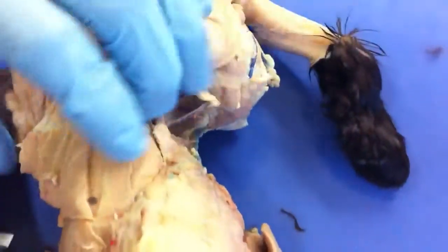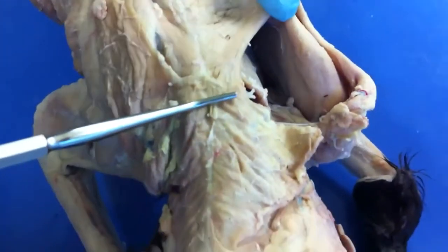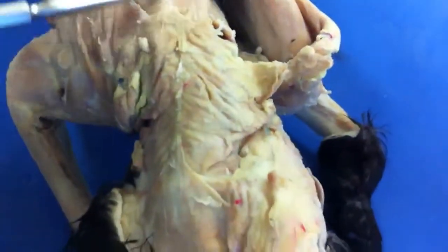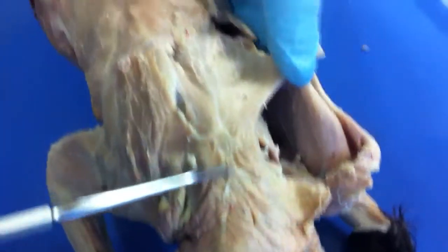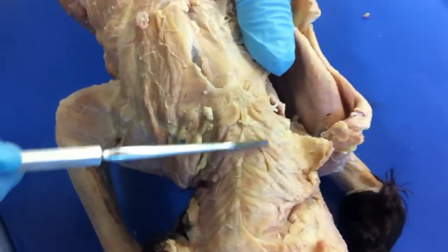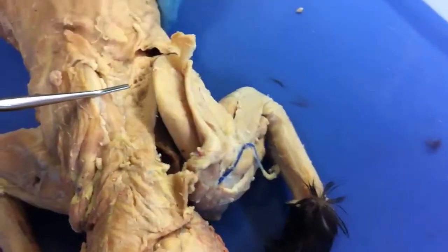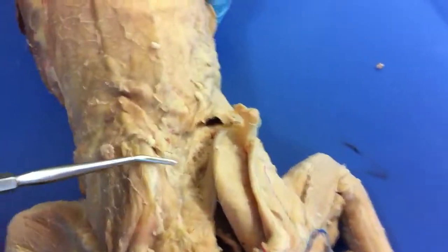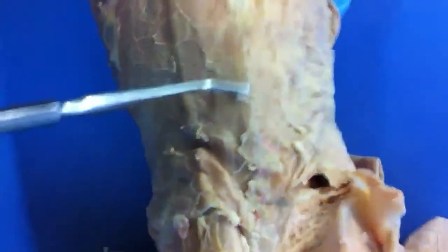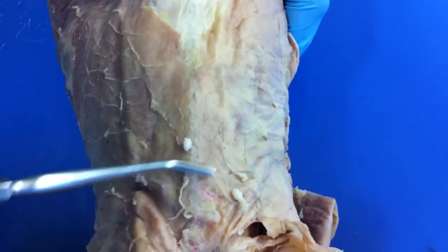Then we have the acromiotrapezius, which is behind the clavotrapezius. It originates at the spine of the scapula and kind of goes downward. And then posterior to that, we have the spinotrapezius.